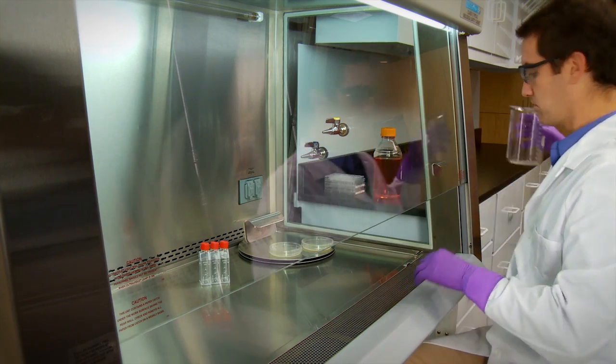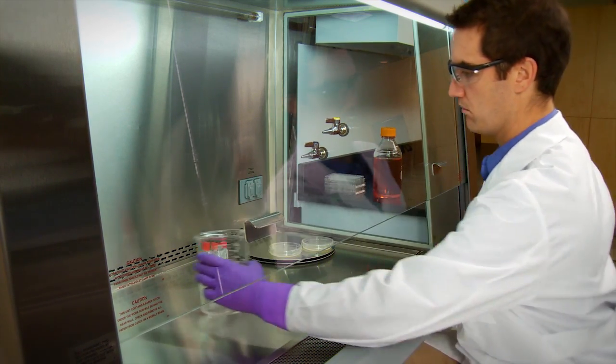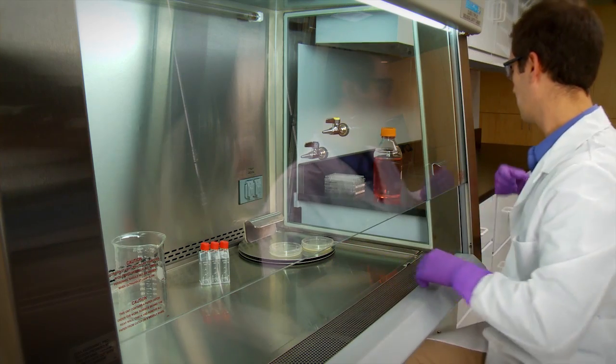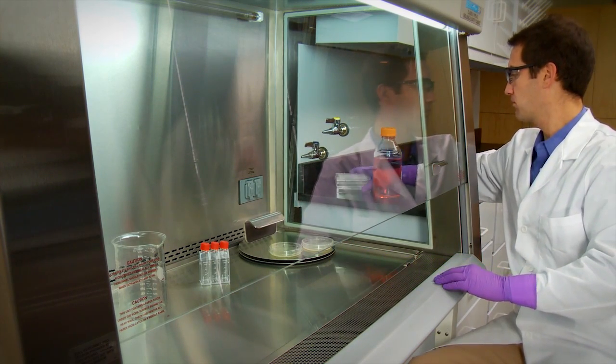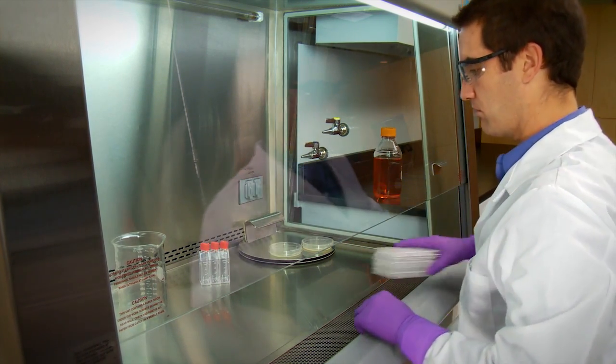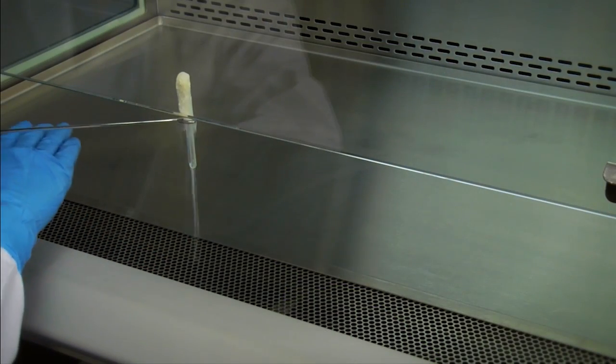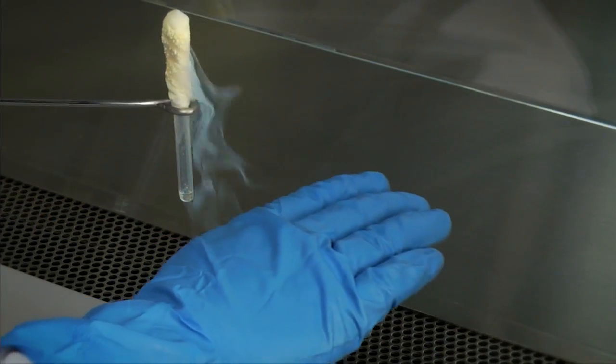This minimizes the number of arm movement disruptions across the fragile air barrier of the cabinet. If possible, keep physical activity in the lab to a bare minimum. Too much movement past the cabinet can disturb the cabinet's airflow.